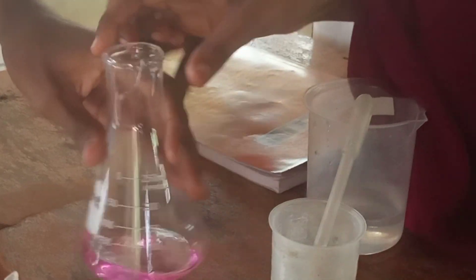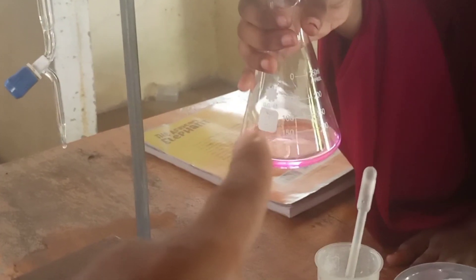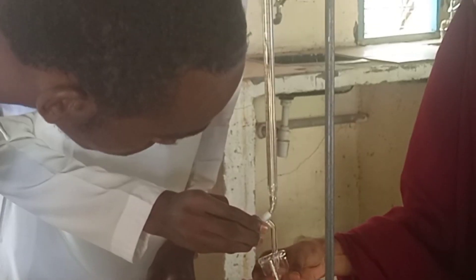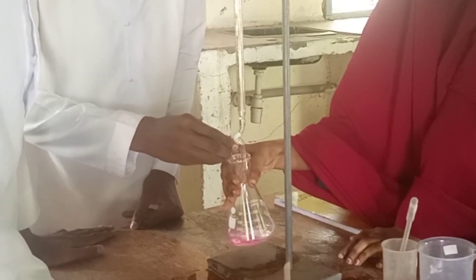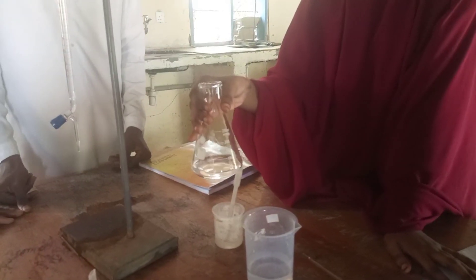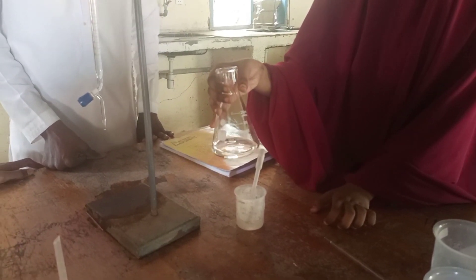The next procedure: you titrate this solution with the solution in the burette until the pink color just starts to disappear. As you can see, the pink color of the solution has started to disappear — that is now the end point of the titration.